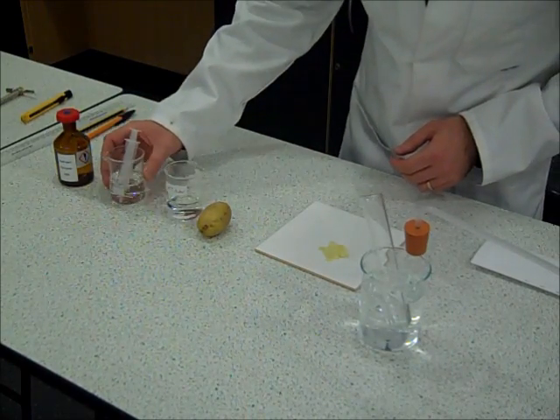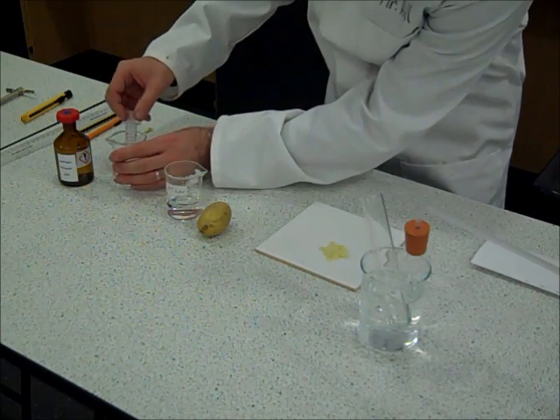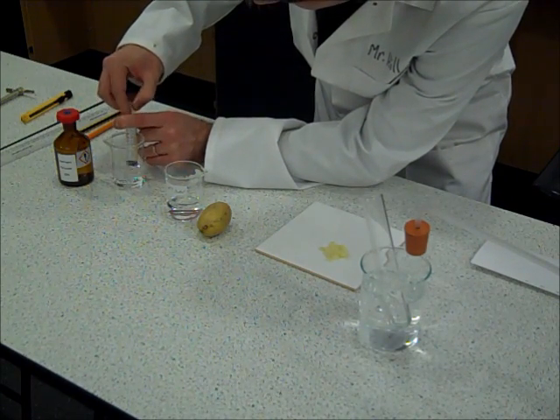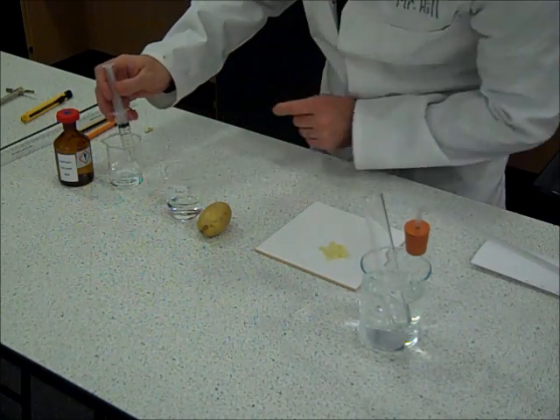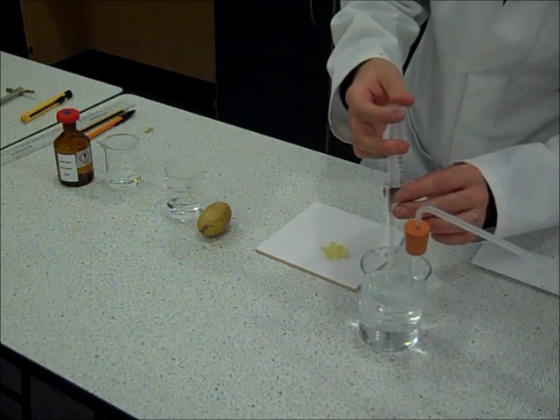The first thing I'm going to do is to put my substrate into our boiling tube. I'm going to use, as I said, the same volume and concentration which is 10 millilitres each time.